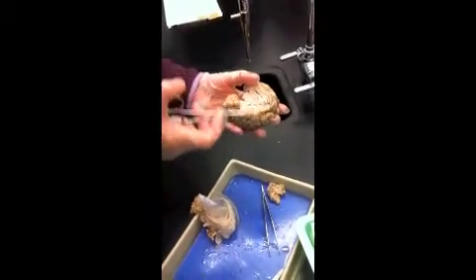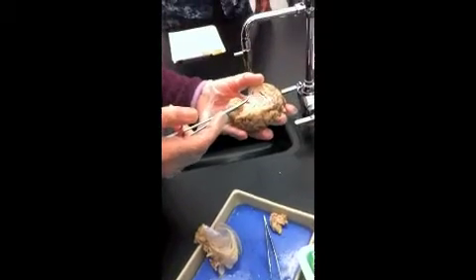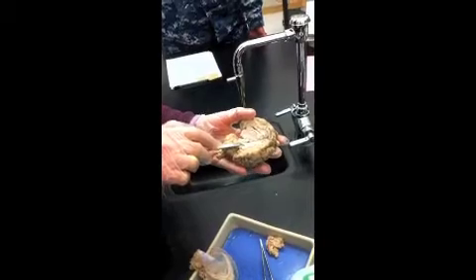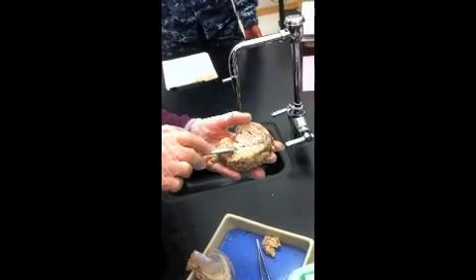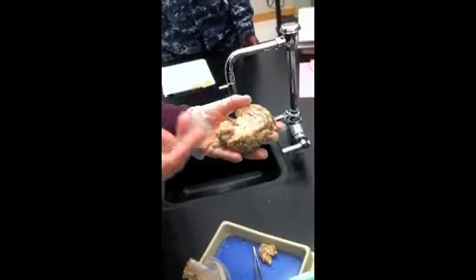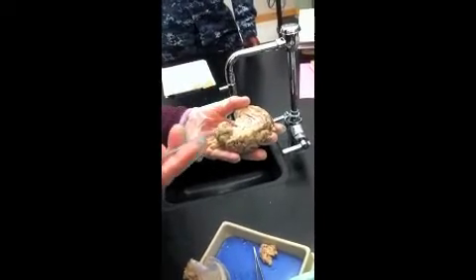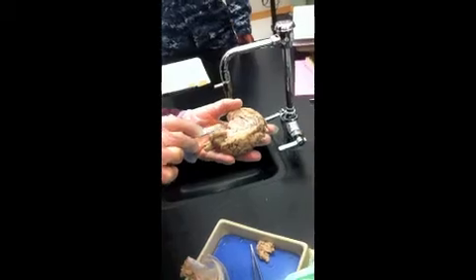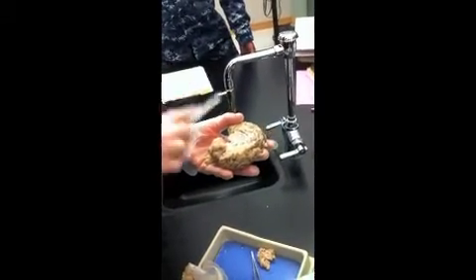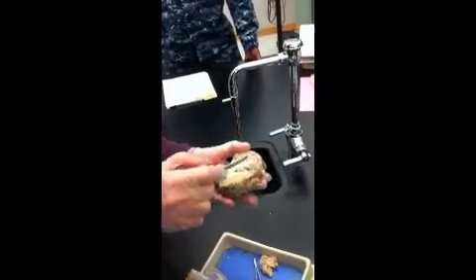And beneath the thalamus, in this region, is the hypothalamus. Literally means below the thalamus. The hypothalamus is a real important, it's like the control center for the autonomic nervous system. And it continues as the infundibulum to the pituitary, which I tore off.